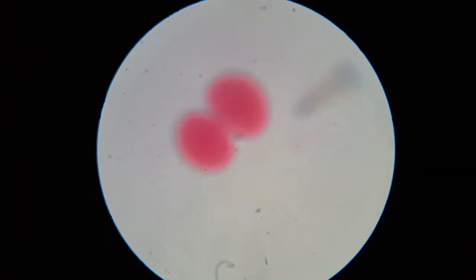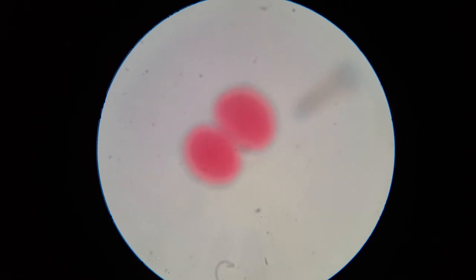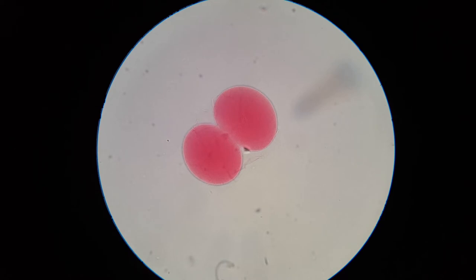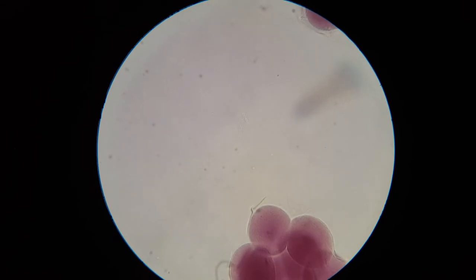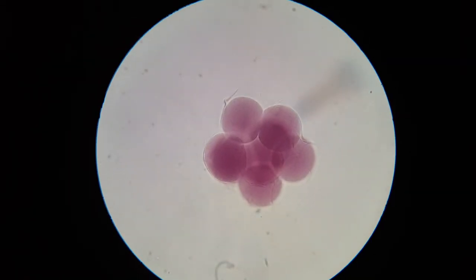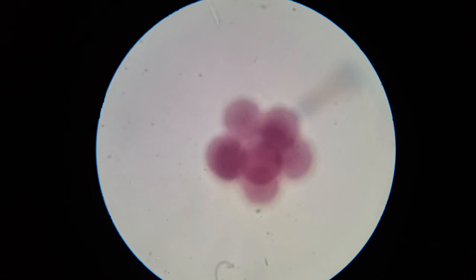We'll switch to the 40x objective. So the two-cell stage of embryonic development — the slide is called Starfish Two Cells. Now we're switching into place Starfish Eight Cells. Very quickly, let's see if we get lucky — and we have gotten lucky. I didn't change the focus or anything, and there are eight cells.